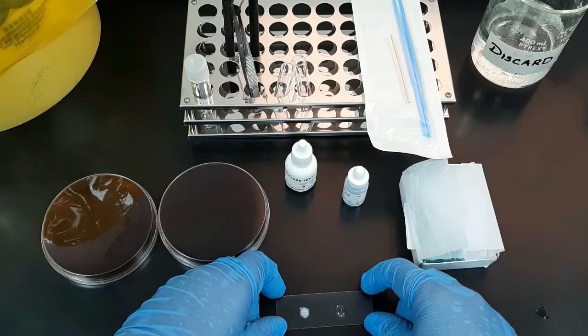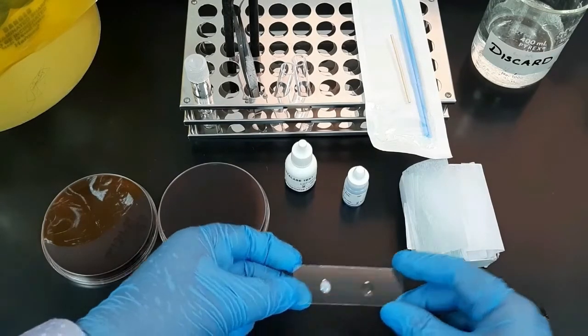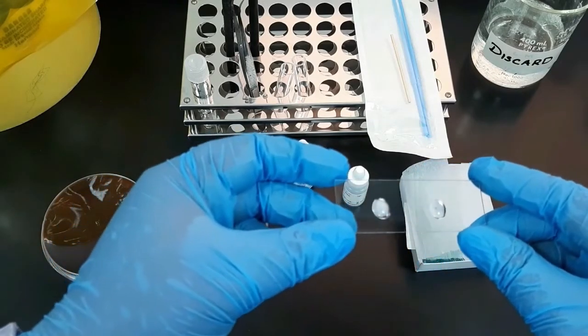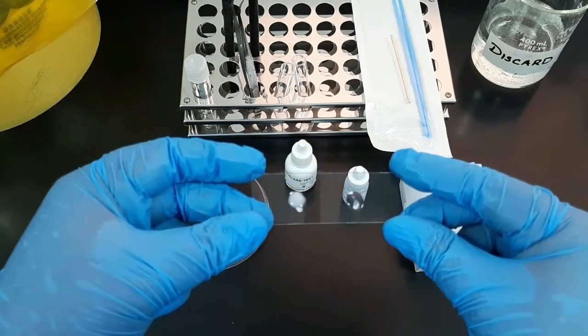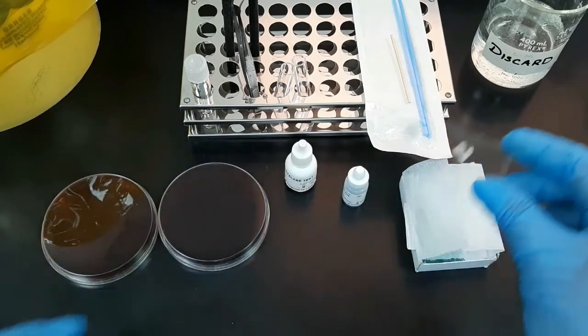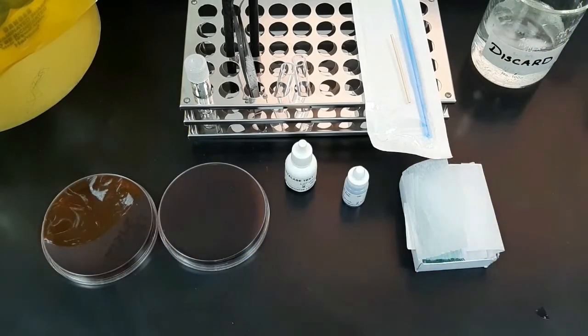Let's see a closer look. The organism with the positive control shows an effervescence of bubbles, while no bubbles are formed in the negative control organism. Discard the slides into the discarding beaker.